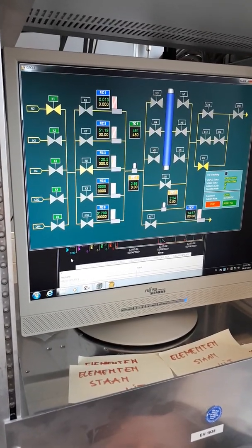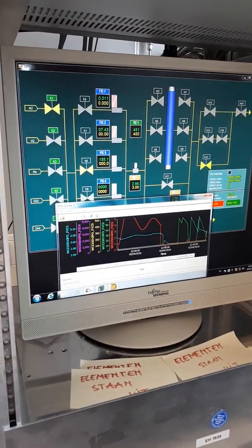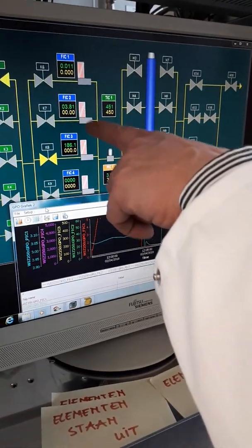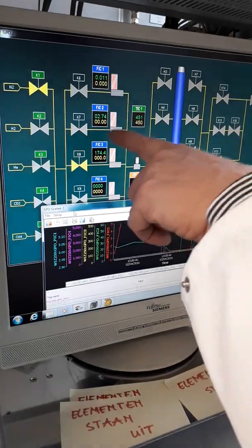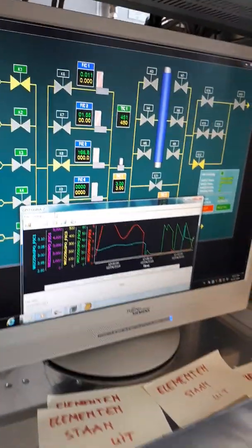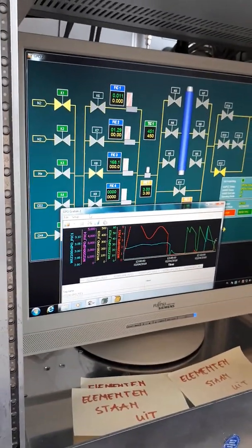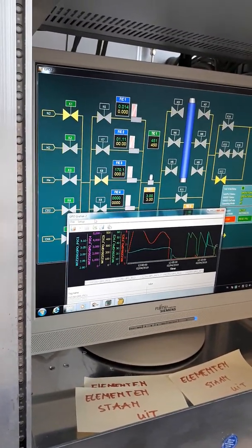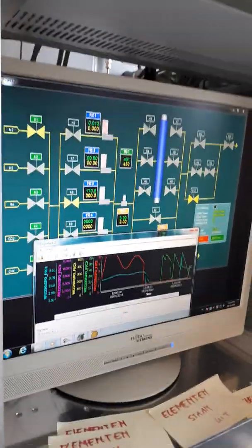And it could, for example, be that we set the oven to the right temperature, but there is a mismatch with the thermocouple or something, so that it doesn't reach the temperature that we would like. It was at 3 bars continuously, but exactly at 50 milliliters a minute. That's the strangest value you can have, because that's the maximum of the flow controller. It can be 50 milliliters, but it can also be more, that it's not reacting properly. That's why I go down.